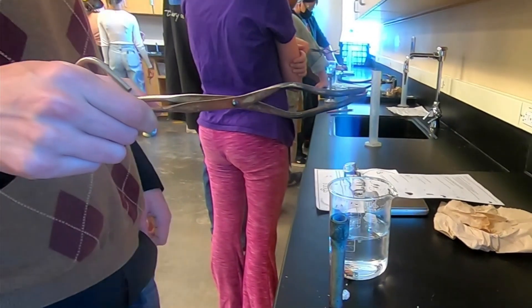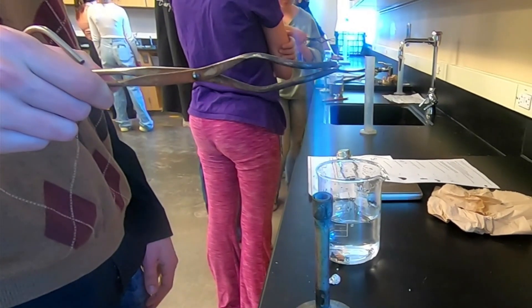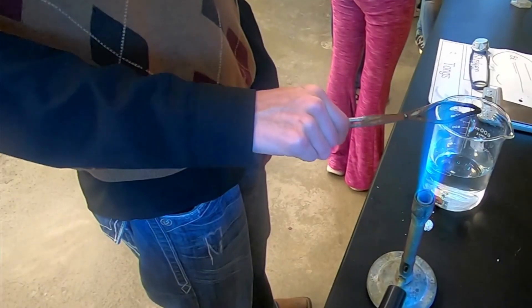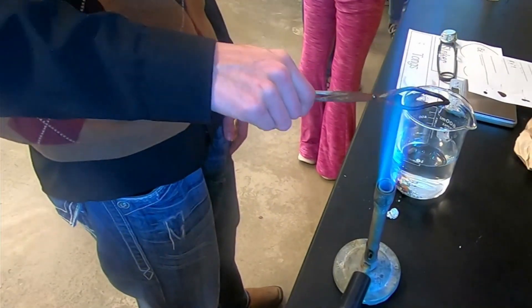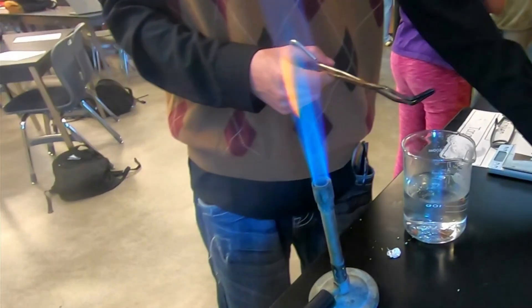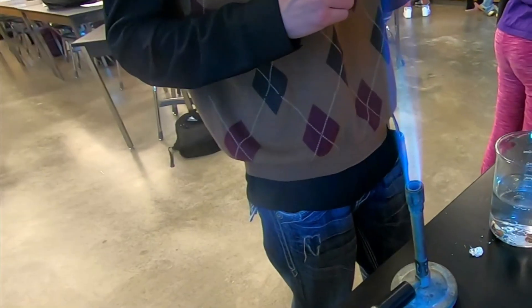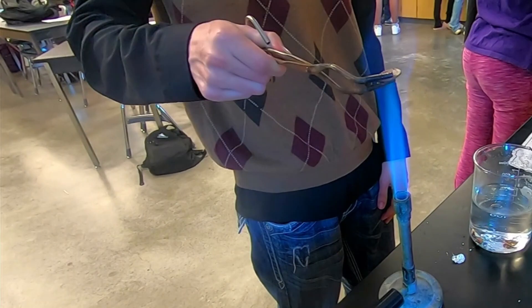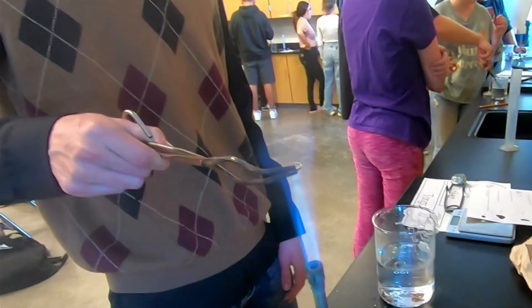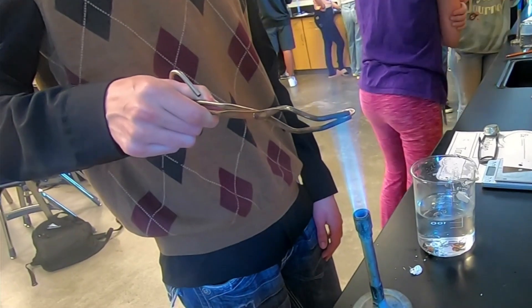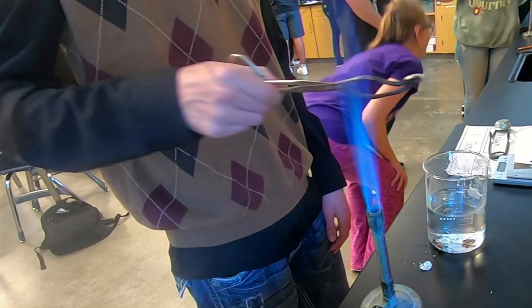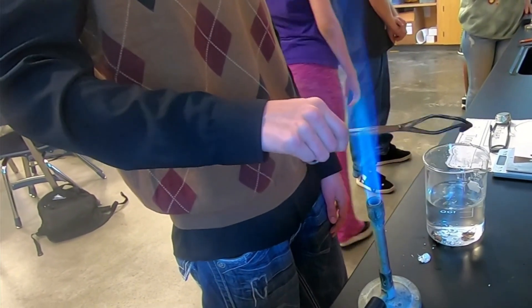Let's watch just a couple more. I tried to get decent angles so that you could actually see the penny starting to change. The process took quite a while, so I didn't want to have too long of a video. You can also see on the table there, between the Bunsen burner and the beaker, a little bit of silver metal that made it onto the table. That's what we're collecting in the beaker as well as the copper shells of the pennies.